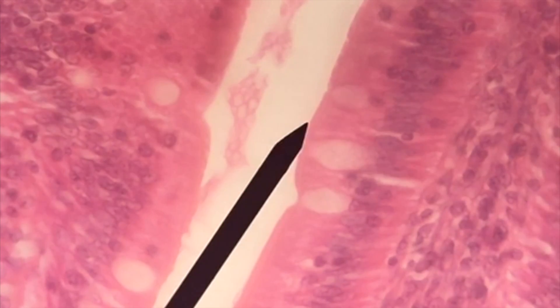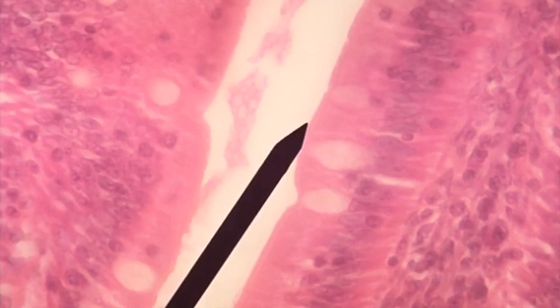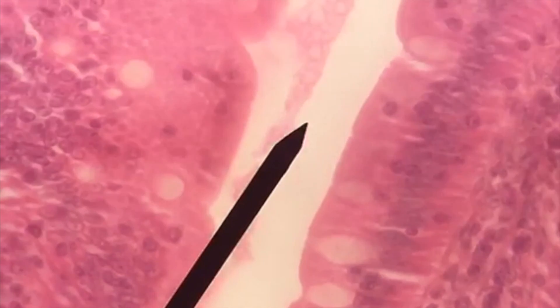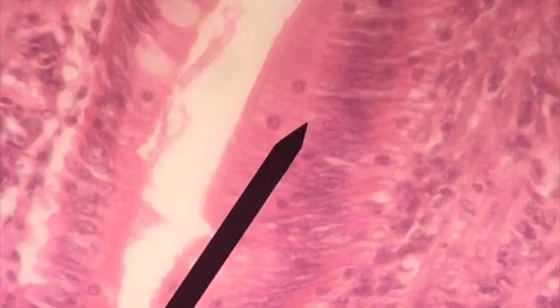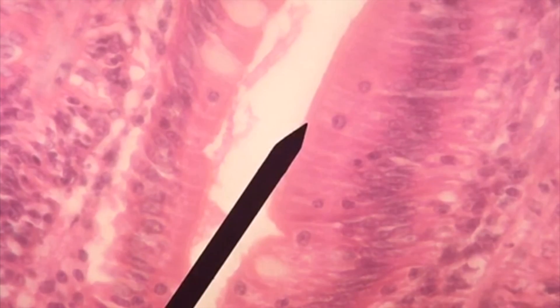The second modification we're going to see — and it's a little harder to see, but it is there — is that thin pink brush border. It is also called the microvilli, meaning little fingers. The function of this is to maximize surface area so that we can maximize absorption of nutrients during digestion.